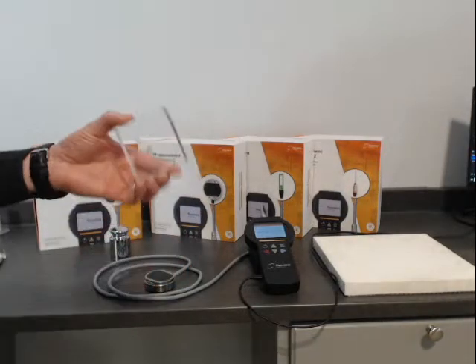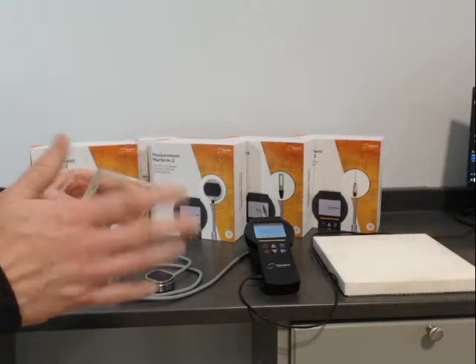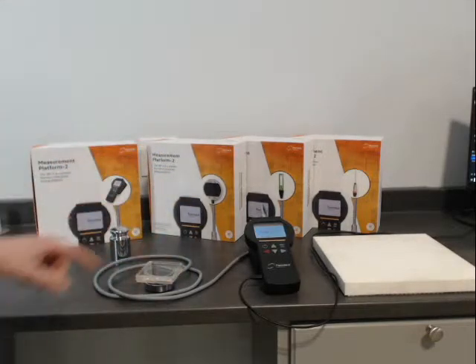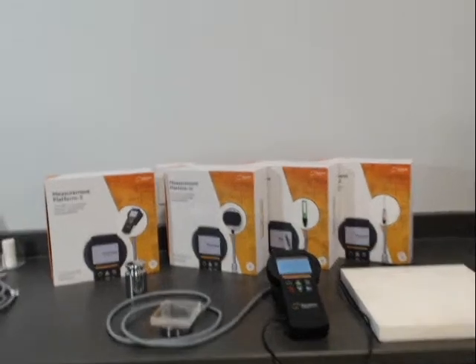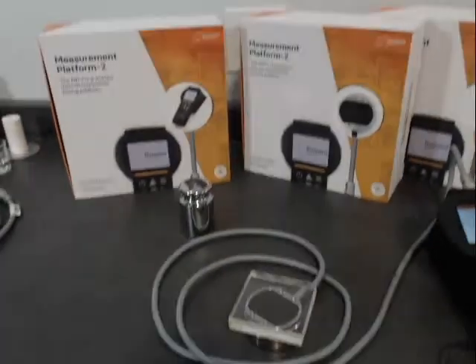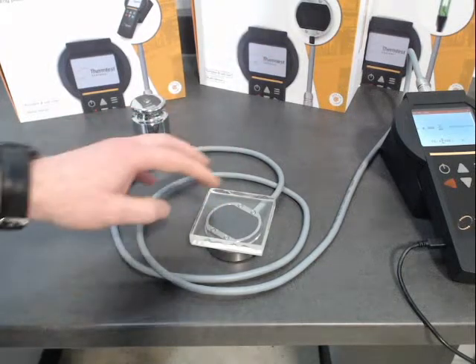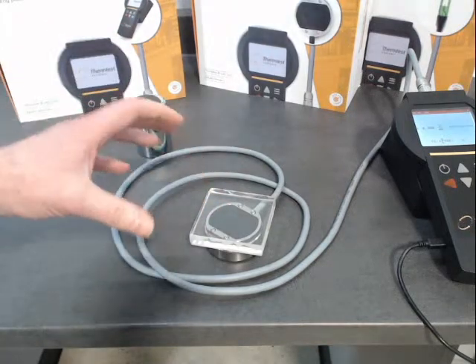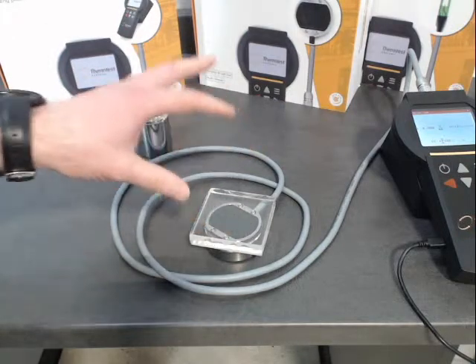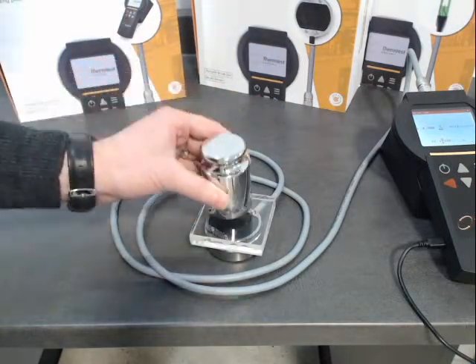So we're going to measure this Pyrex, around half inch thick. You want to cover the sensor completely, covering the test area which in this case is 12.8 mm — your sample size minimum is around 30 mm or bigger. We use a standard weight.